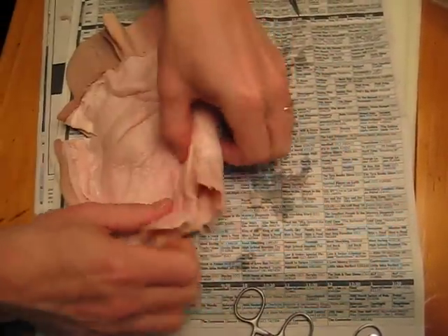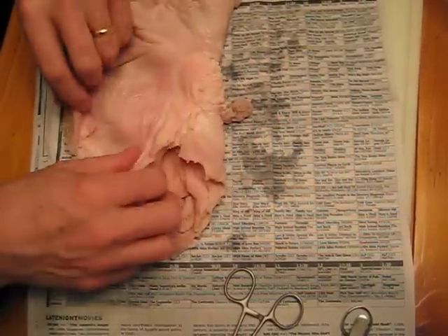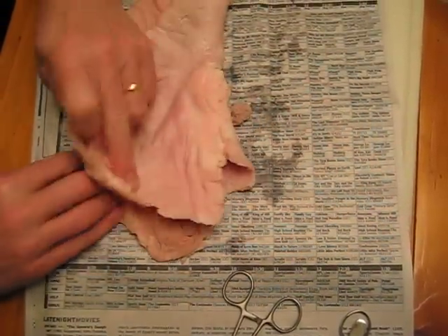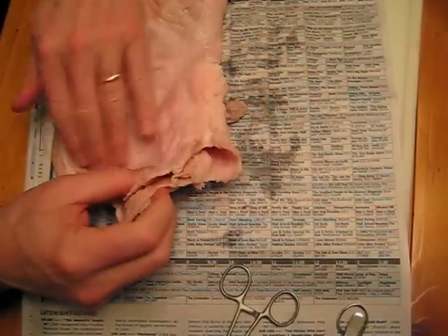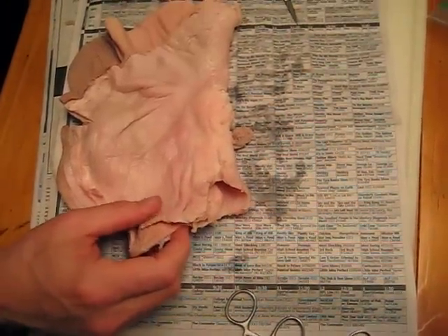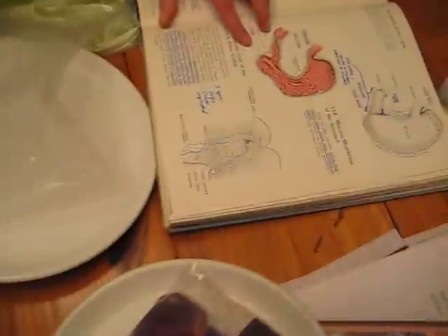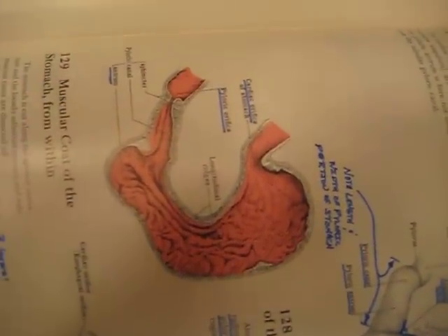This part of the stomach on top is called the fundus of the stomach. You might want to take a picture over here too, and then take one of the black and white drawing on the upper right because that labels it.